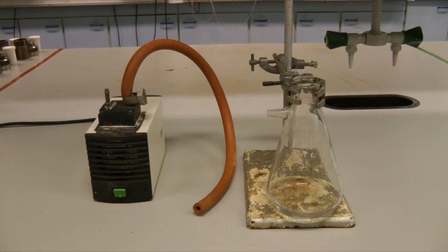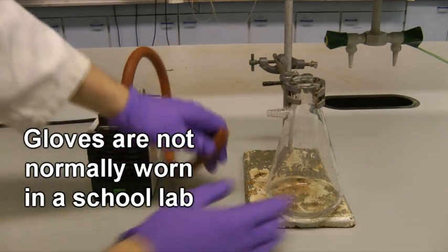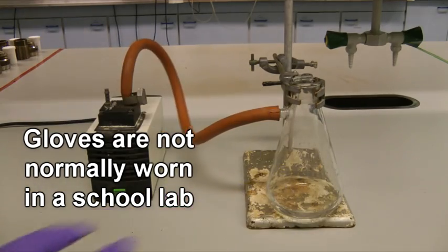We're going to use an electric vacuum pump, although you might use a water pump. This is connected to a sidearm conical flask using rubber hosing.